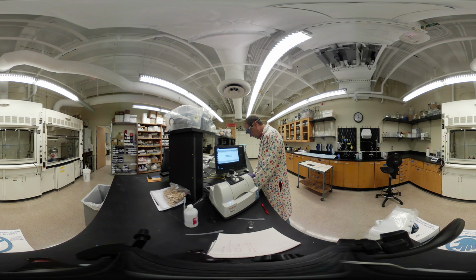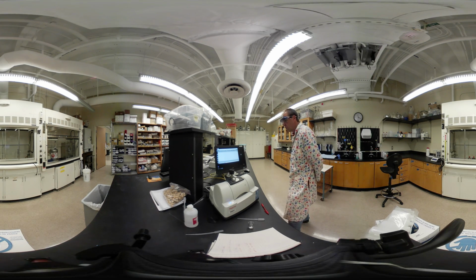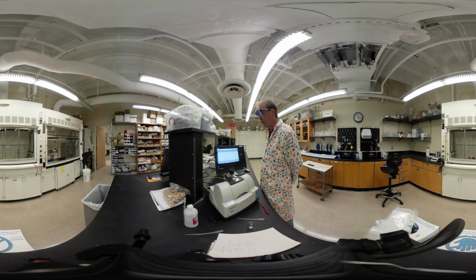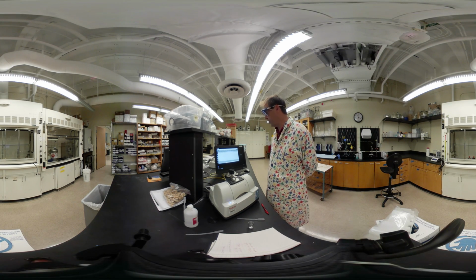We're going to call this Dmap CH3I. And I'm the one taking this, so let's go ahead and put my name on it. Okay, so once you name the file, then you're ready to prepare. We are ready. We say go. It's fairly quick. Again, it needs to do 16 scans. You do multiple scans for error correction and the like.